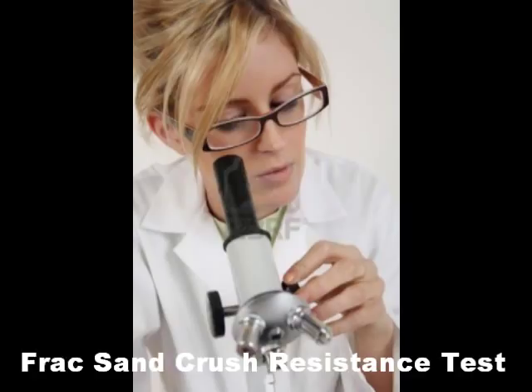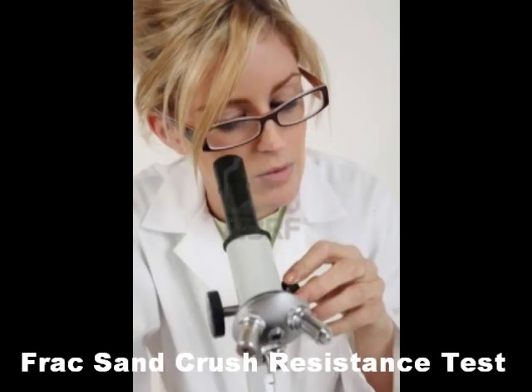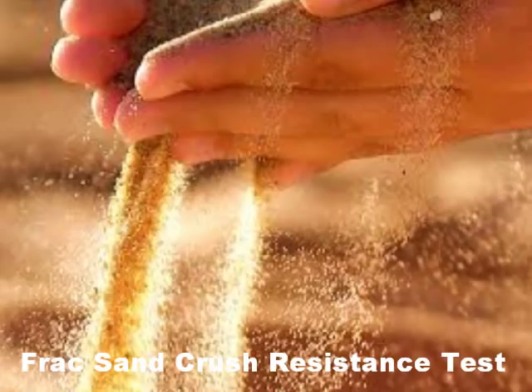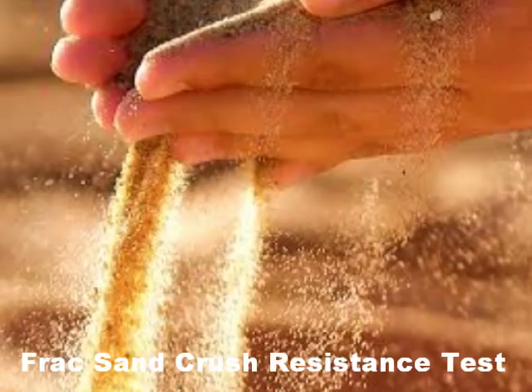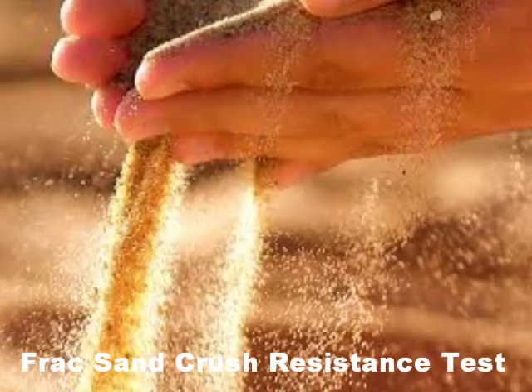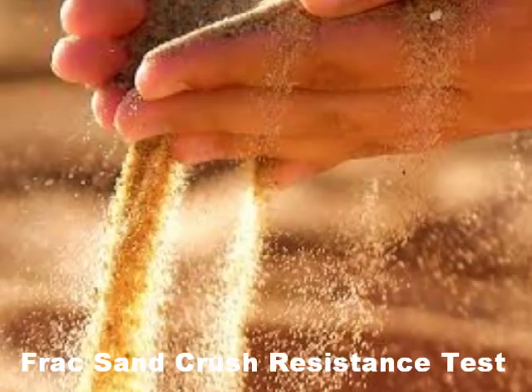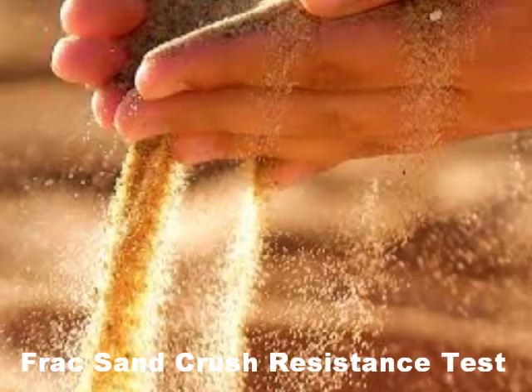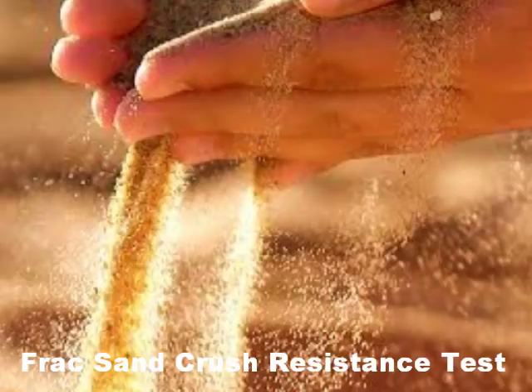Big picture, what we're doing is we're taking a small amount of the sieved down sand that you have. So let's say we're testing sand in the 30-50 size range — we use sand from that size and we load up this test cell, which is basically a piston with two pieces. One is the receiver piece and you load the sand into there. The piston is a separate piece that fits very tightly into that cylinder.